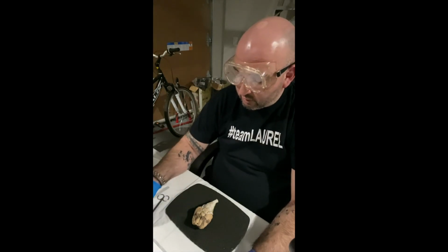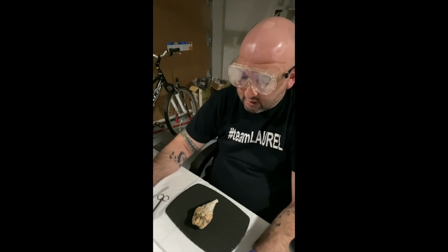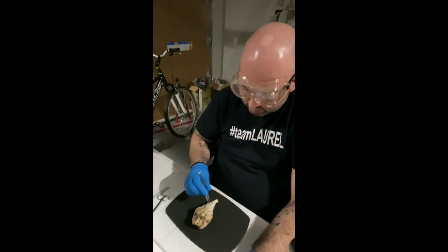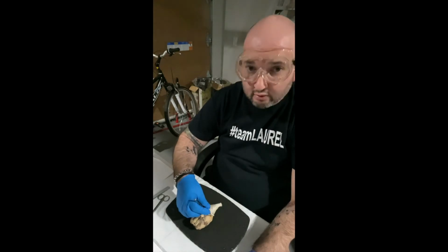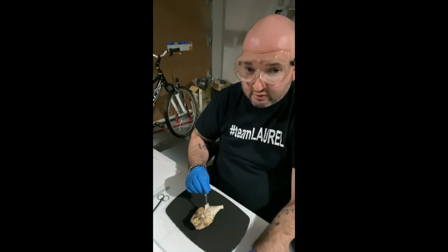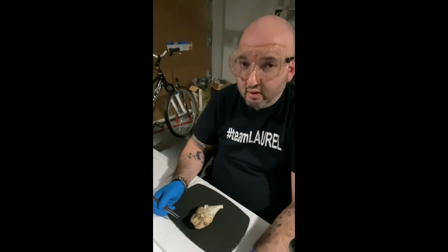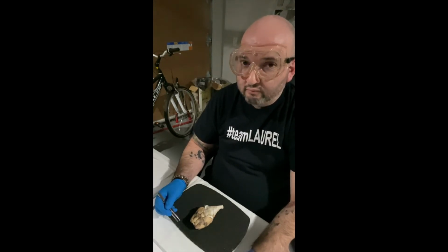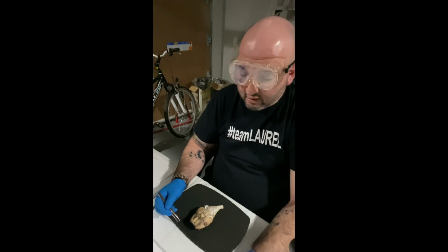So I'm going to start with what's called the meninges. So the meninges, it's this tissue here and here. So these little kind of papery flaps on either side of the sheep brain. Now, in humans, the meninges, if you ever get meningitis, it's inflammation or infection of this tissue, which can lead to pain, cognitive deficits, things of that sort.